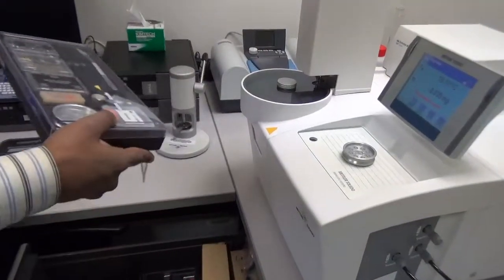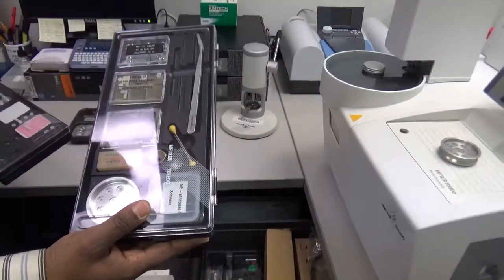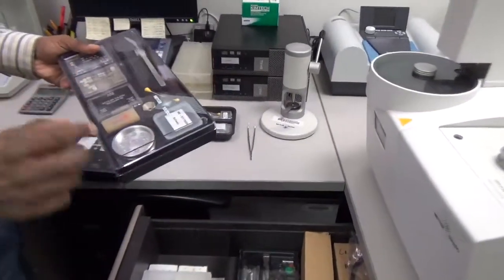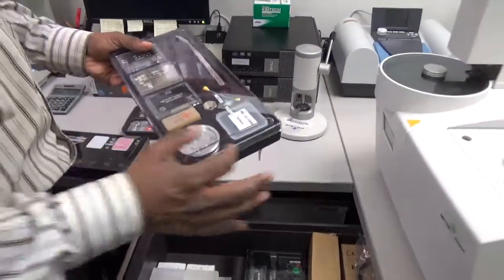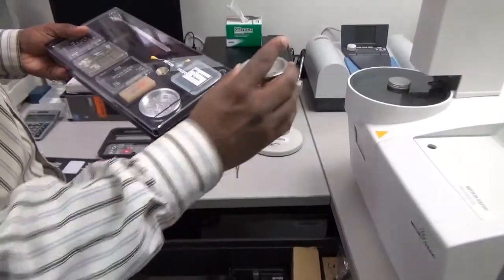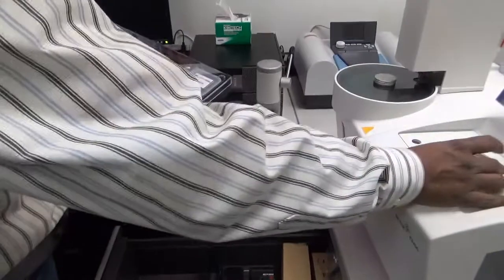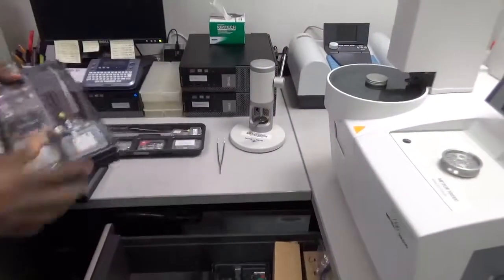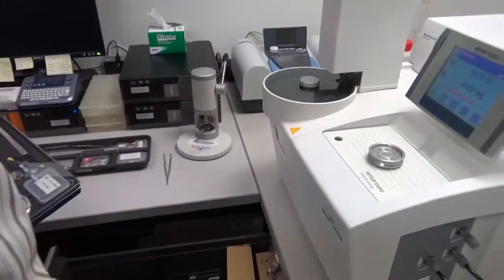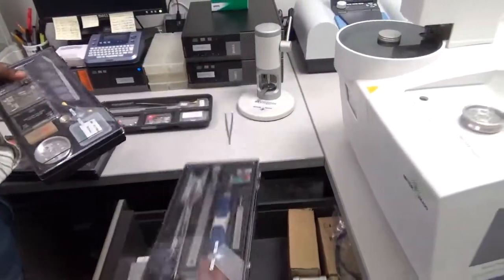There is also the crucible box that comes with the unit, which shows the different types of metal and ceramic crucibles. This is the holder which I also have here for loading and unloading the sample. And this is the tool box which also comes with the unit and has different tools.